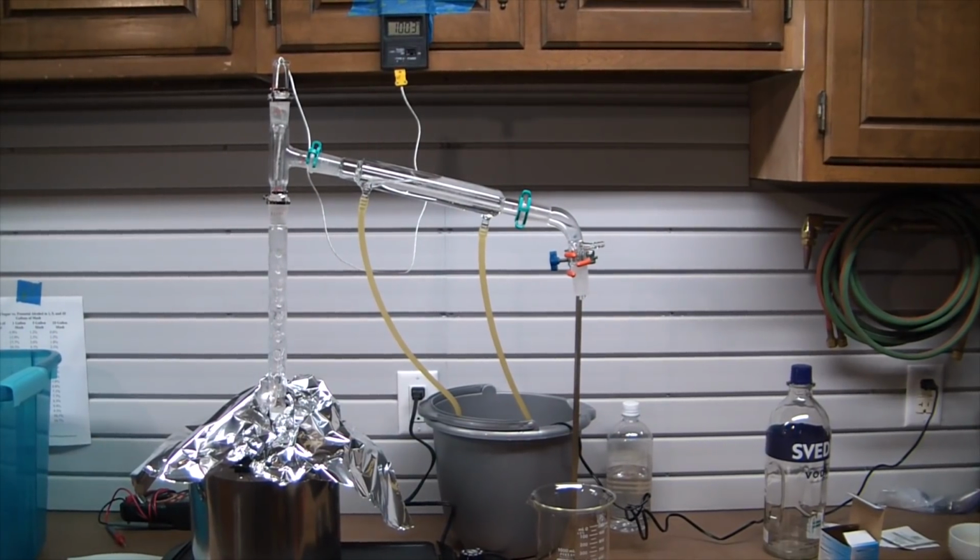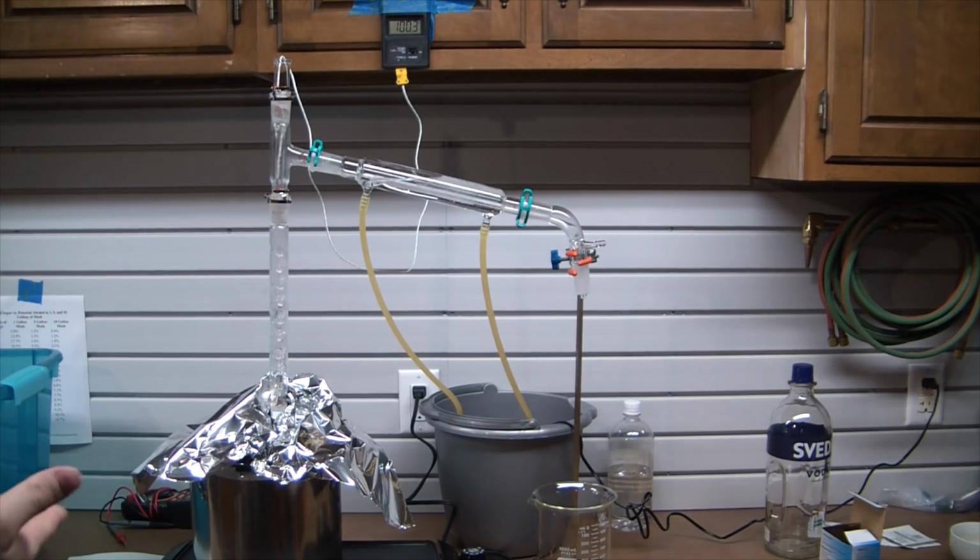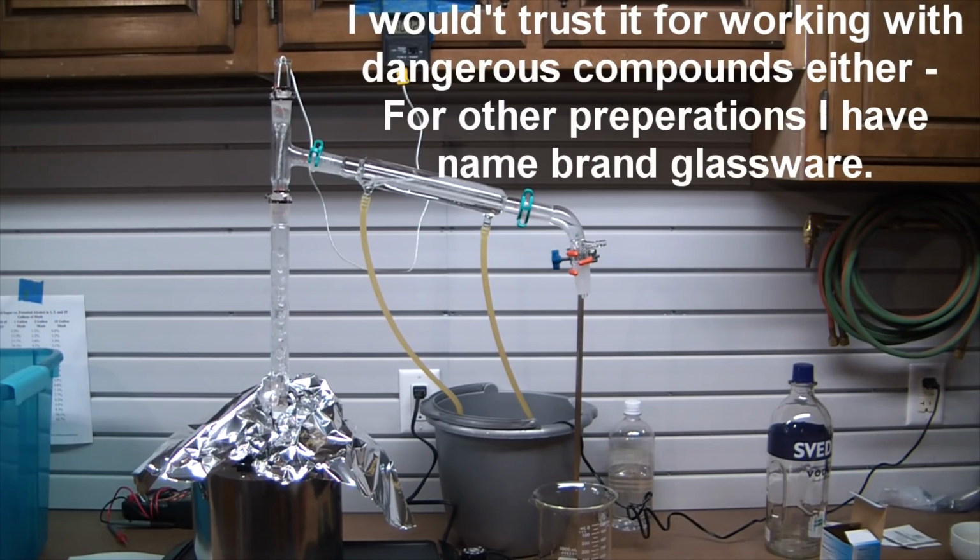So, super cheap distillation setup. You know, the glassware was 30-some bucks. The pot at Walmart was $7. And then the adapter from Lowe's, little copper thread, that was maybe $3 or $4. Obviously, you do want to be careful with this glassware, though. It's not high-quality stuff. Don't trust your life with it.